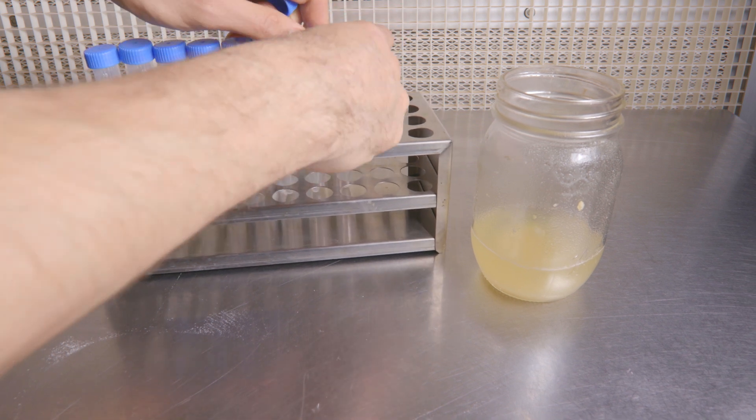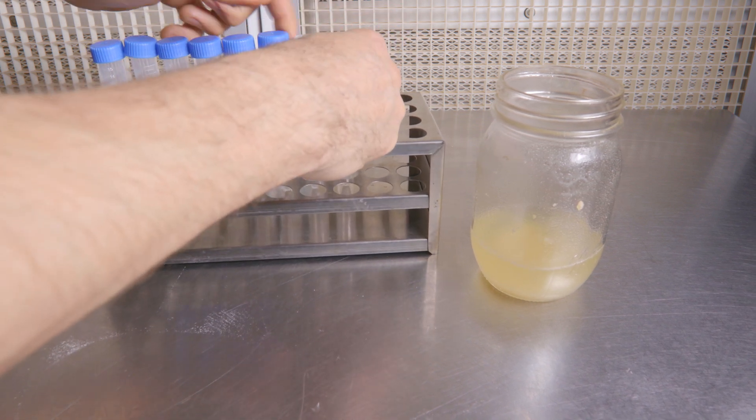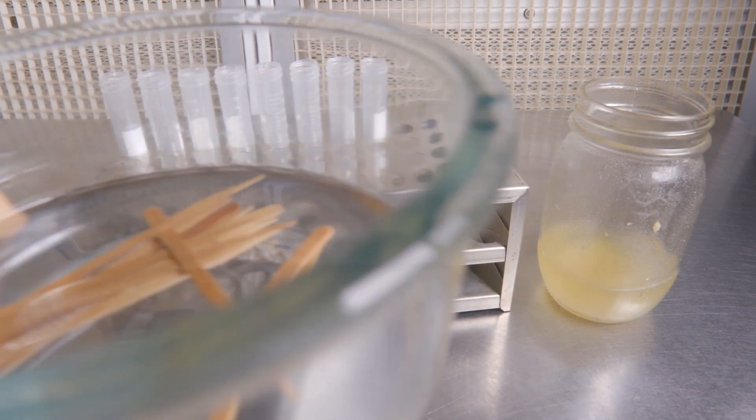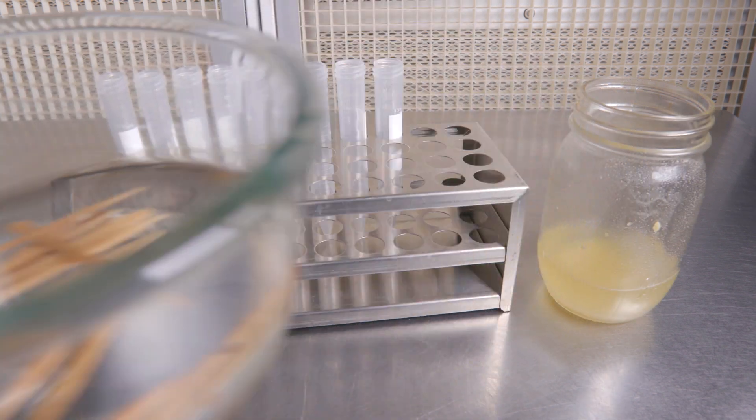But first, we're going to show you an optional step. Here we are adding hydrated sticks to our slants. The reasoning behind this step is that the mycelium can colonize the wood which allows it to survive in storage for longer periods of time.